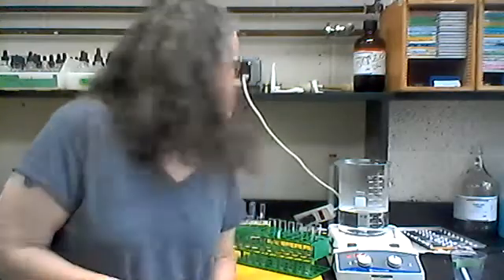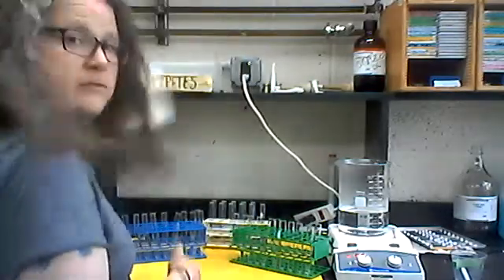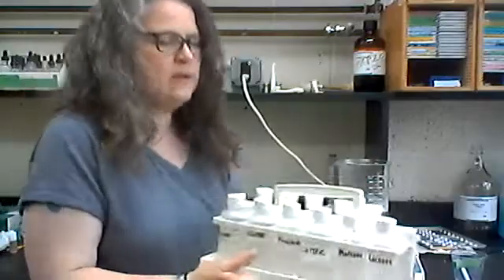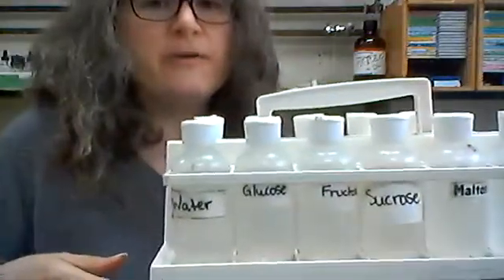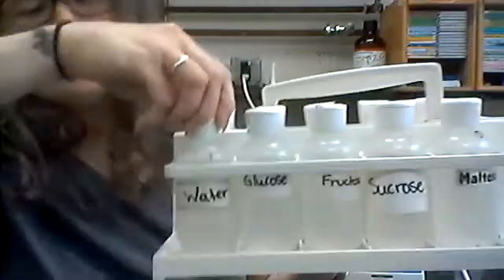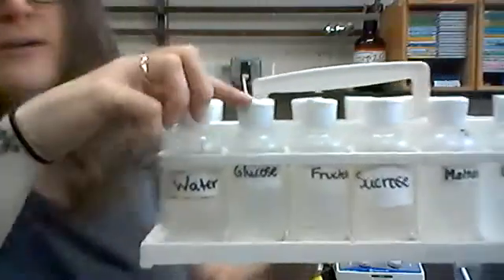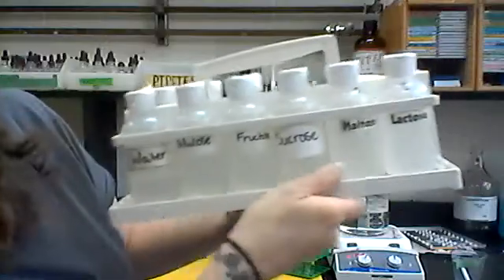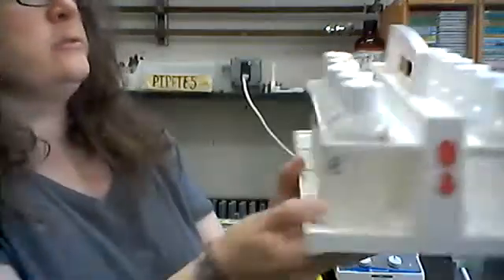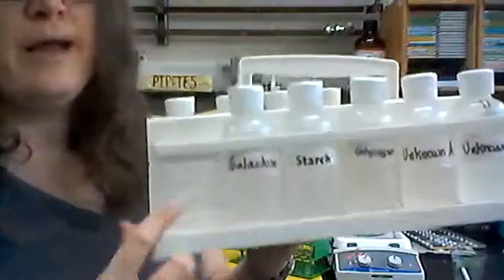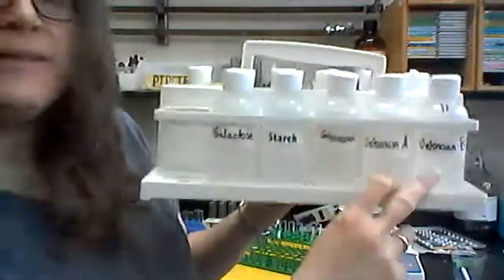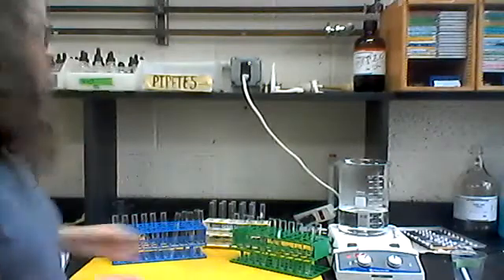So to start off, we're doing carbohydrates this week. We will be looking at a number of different reactions of these different carbohydrates, and I'll have these listed for you on Canvas. We've got our control water, of course, we've got glucose, fructose, sucrose, maltose, lactose, starch, glycogen, and then two unknowns. We're going to run three different tests on each of those different carbohydrates, and you can see different properties for them.